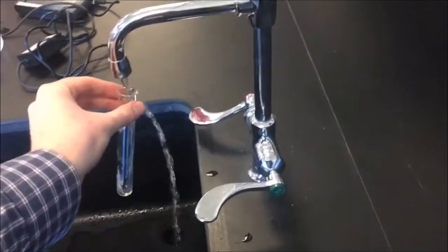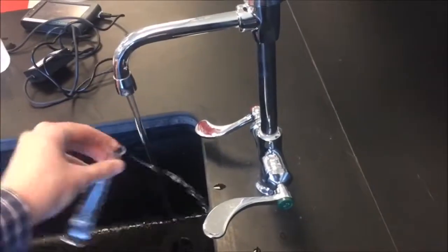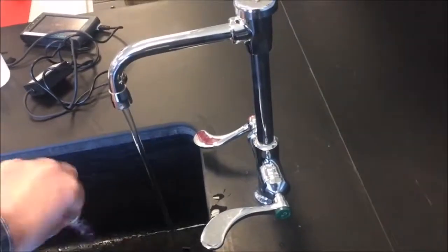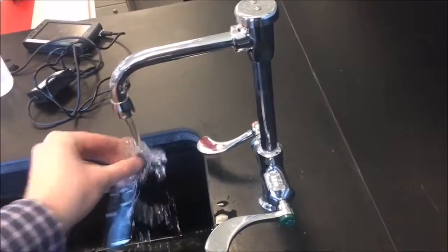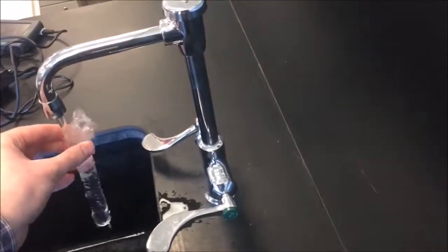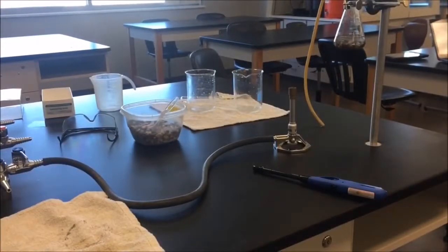As always, let's rinse out our glass equipment about five times, just so that we make sure it gets nice and clean. This can be a pretty messy lab with a lot of different parts, so please just make sure to take the time to clean up when you're finished.